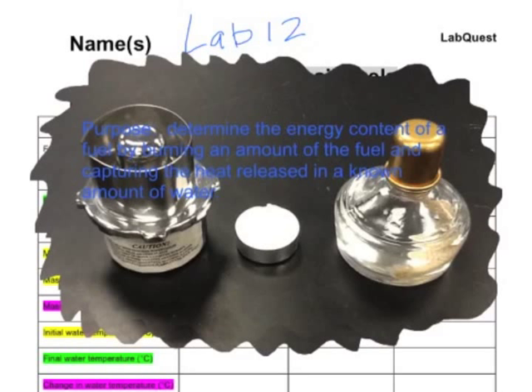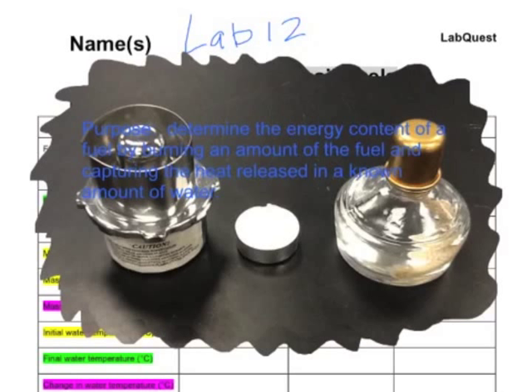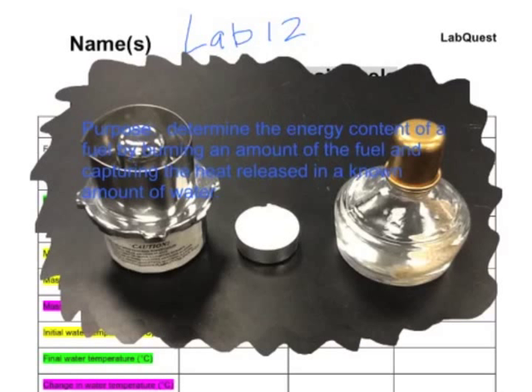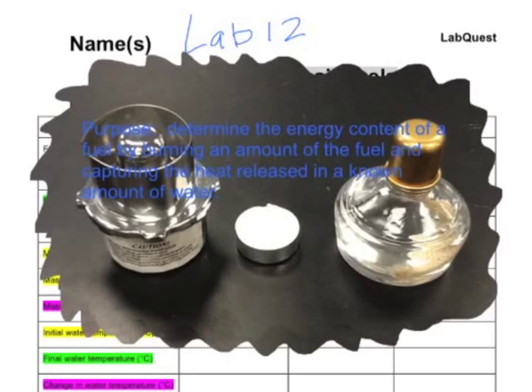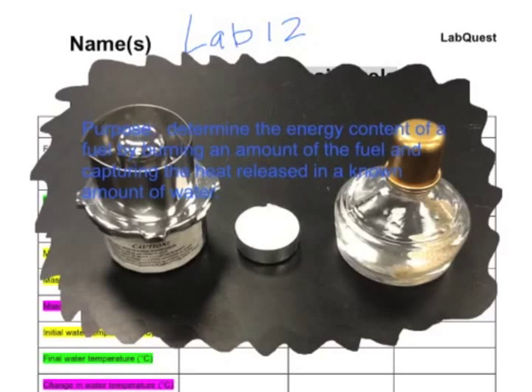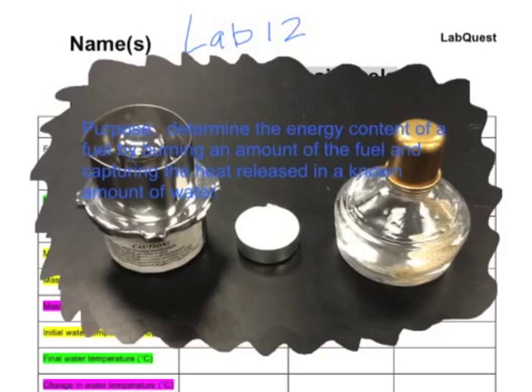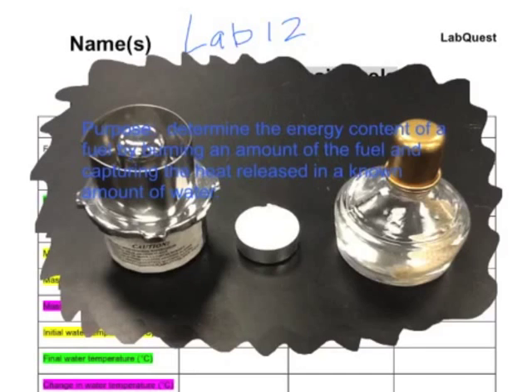The purpose of this lab is to determine the energy content of a fuel by burning an amount of the fuel and capturing the heat released in a known amount of water. This is calorimetry — you did something similar in 10th grade biology when you burned types of food. The connection to the fourth iBook on climate is that when you burn any type of fuel, a combustion reaction releases carbon dioxide and water vapor, and carbon dioxide is a greenhouse gas that can impact climate.